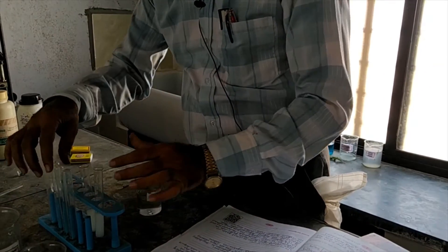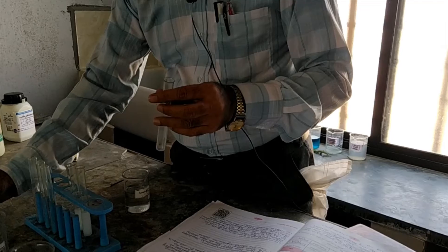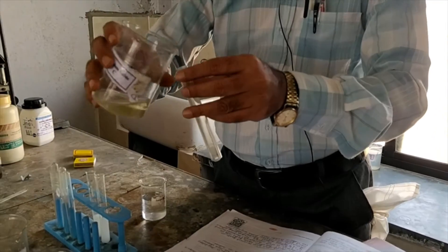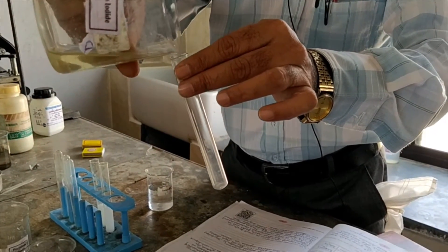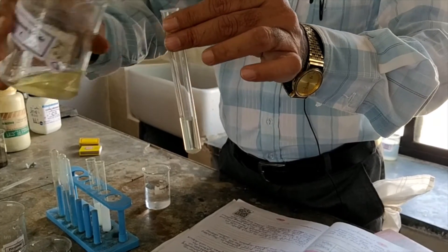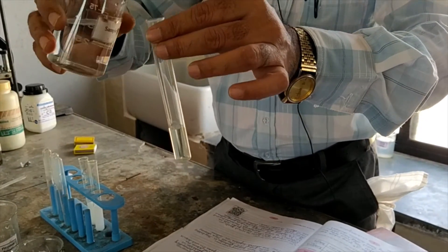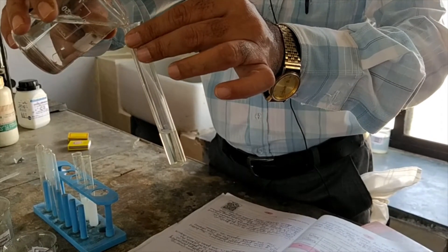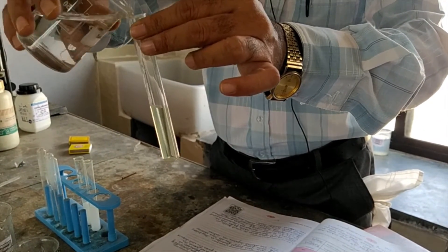Now take the third solution, that is potassium iodide — see here, this is potassium iodide. Again, pour a small amount of AgNO3, that is silver nitrate, and observe the colour change very carefully.